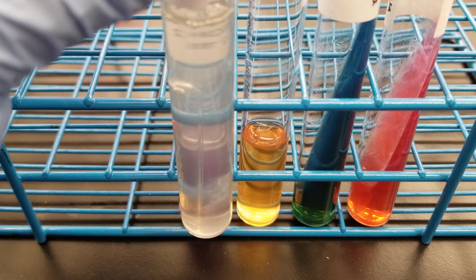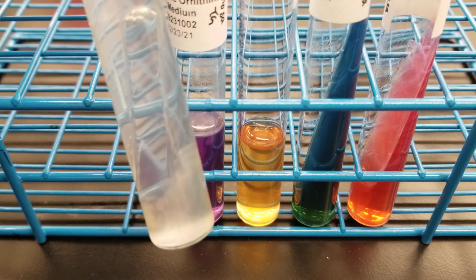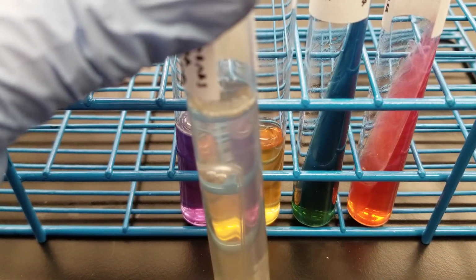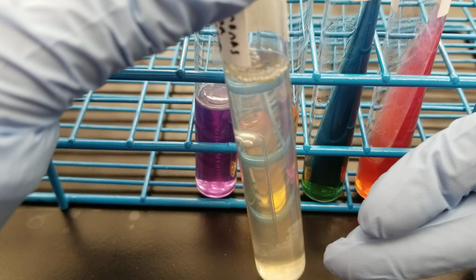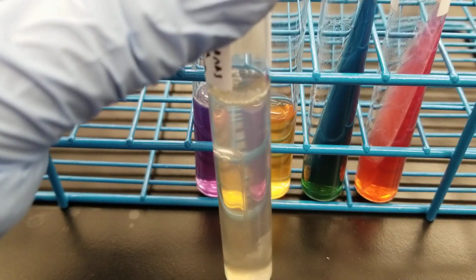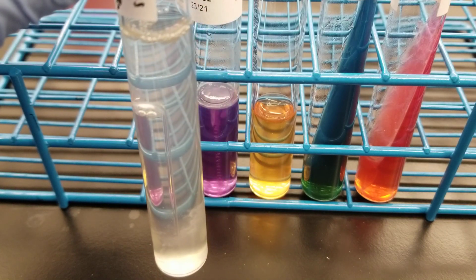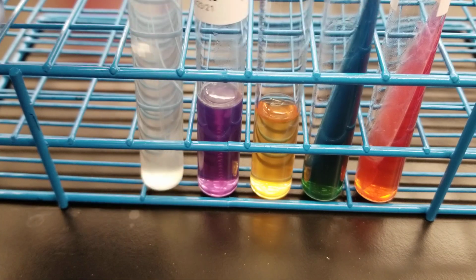It does have bubbles in the Durham tube, and sometimes it is super bubbly. Right now you can see just bubbles at the top. Sometimes I see it where the bubbles are just rising from the bottom going up to the top. And I think you've seen that in a different video that I did. But it is absolutely there. It's growing. You see all that. And there are lots of bubbles.